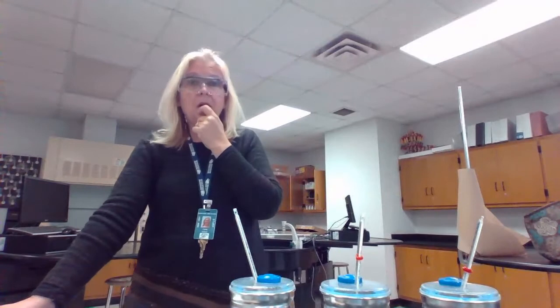You can make a second data table having all of the data, including the raw data that we measured and the calculated data that we just calculated, or you can make a separate table that holds just the calculated data and the original data table holding all of your measured data. It's up to you. Please make sure that all of the unit labels are provided. At this time, we are not going to worry about uncertainties. We are just going to worry about you having unit labels. So let's go over that.